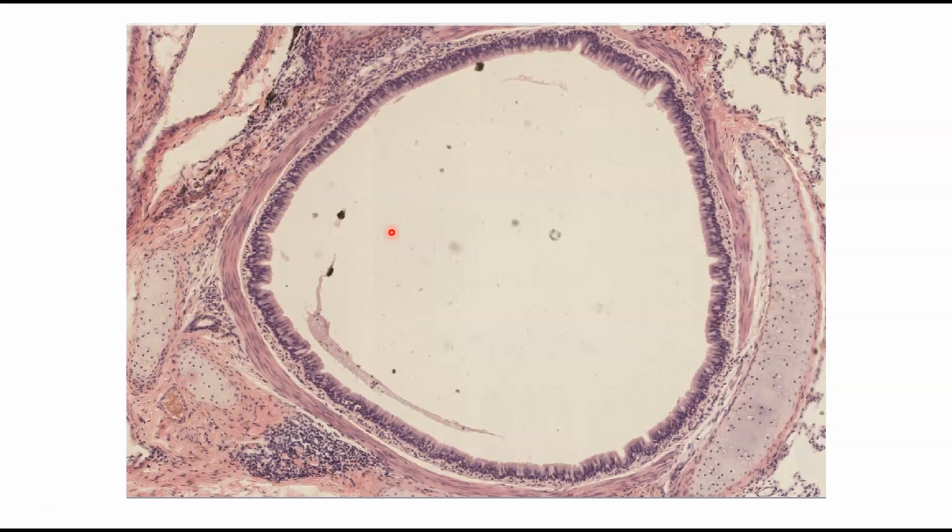If you watch my lecture video on the respiratory system, you will note that by the time you get to the bronchi, so the primary and the secondary, especially in the secondary, the cartilage that surrounds these tubes is not going to be a complete circle like cartilage. It's not going to be C-shaped like it was in the trachea. It's going to be irregular plates that kind of surround the outside.